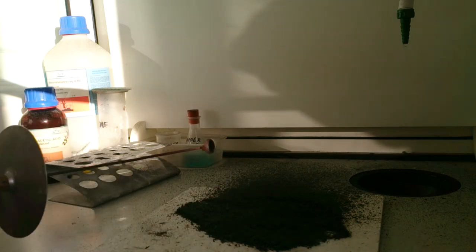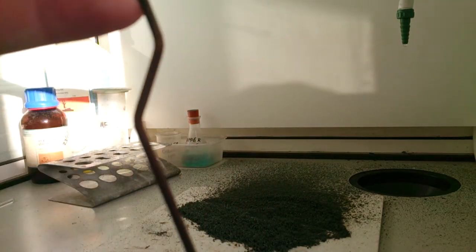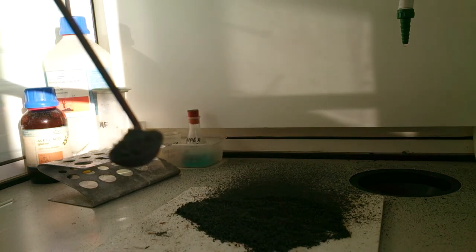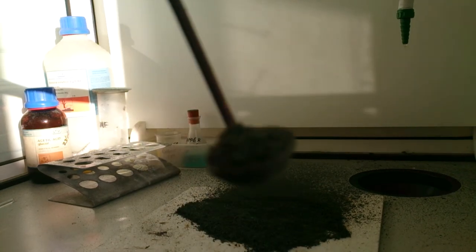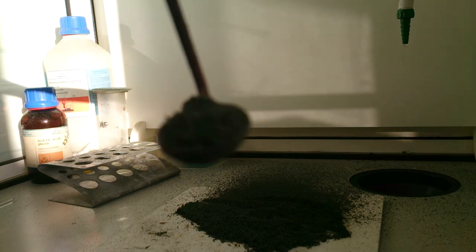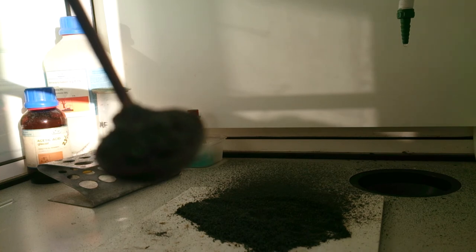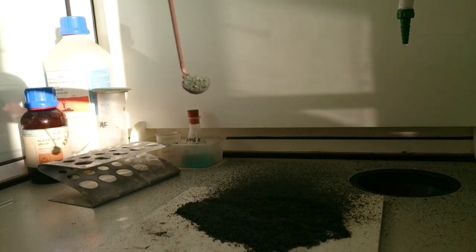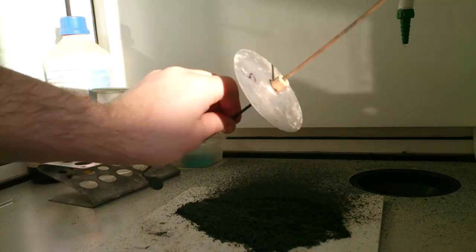Excellent. Now, if I take a little sample of it, you can see quite nicely that it's gone from that orangey sort of powder when it focuses. I don't think it's going to focus at all. No, I decided not to focus on this. OK, well, here we are. To some sort of green chromium colour.